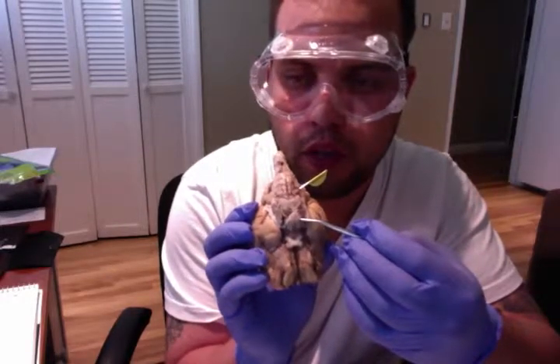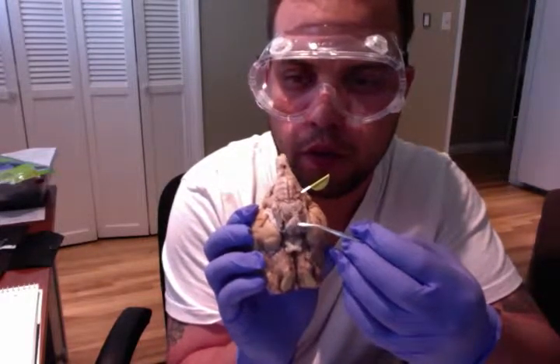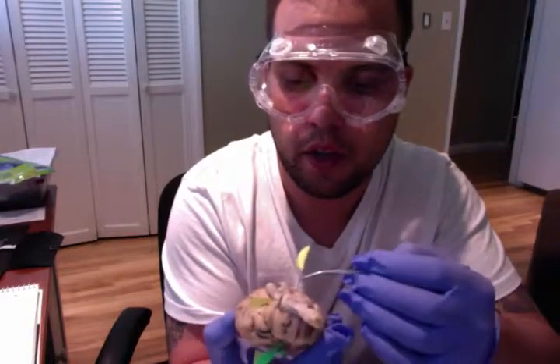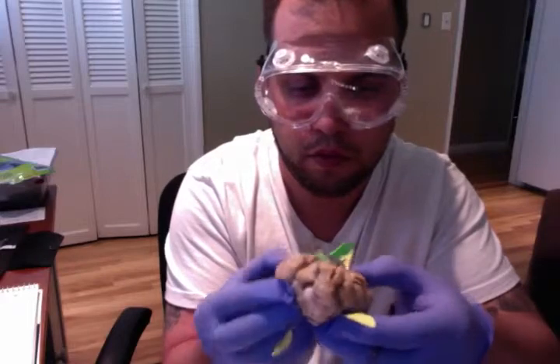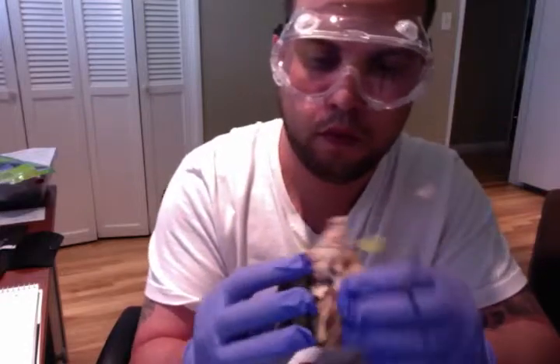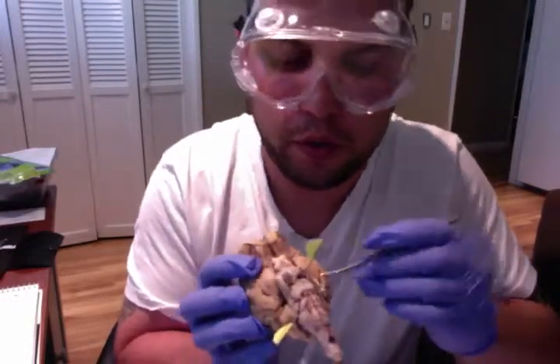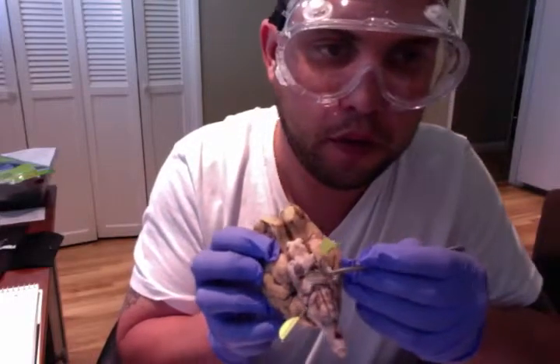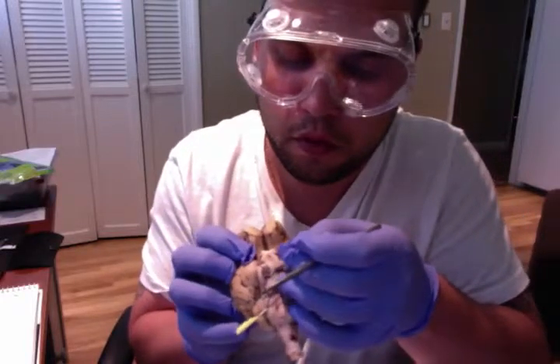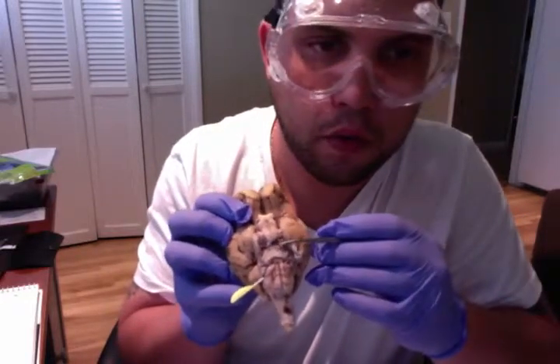Moving on, we have the oculomotor nerves. The oculomotor nerve is found in the medial surface of each cerebral peduncle. The nerve supplies muscle to the eye, and that would be the oculomotor nerve. Excuse me, oculomotor nerve right here. I'll lift it up here so that we can see. This is our nerve. I'll move this. Again, we have our oculomotor nerve right here.